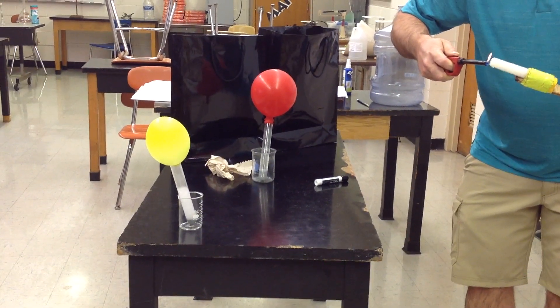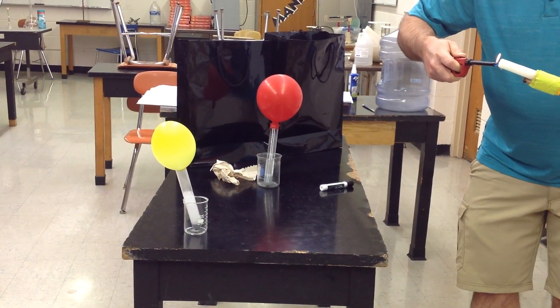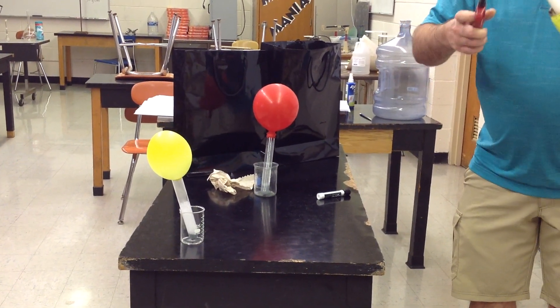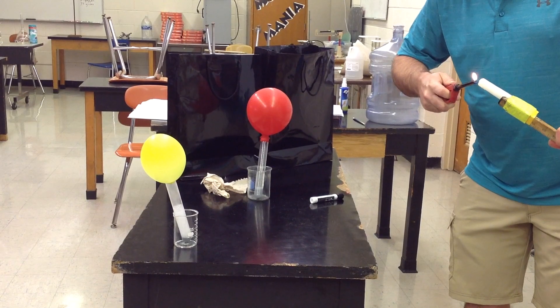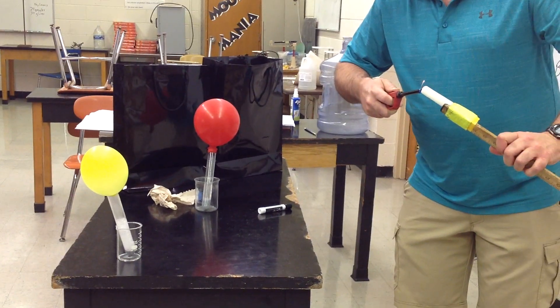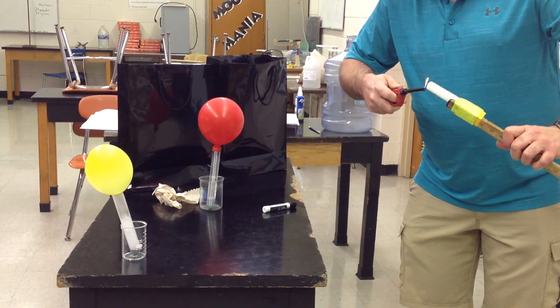Okay, so what kind of gas do we have in that balloon, guys? Does anybody know? I feel like they're all yelling the right answer, don't you? I do. Someone out there, somebody knows. Somebody has finished that reaction - they know what's in that balloon.